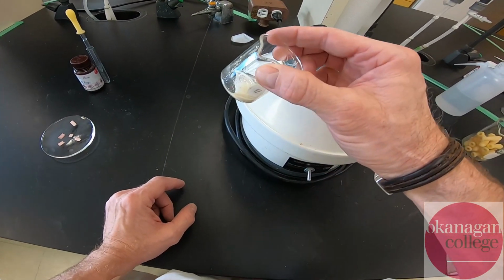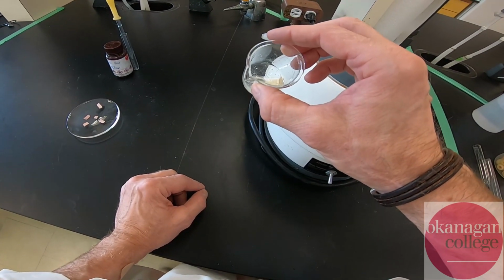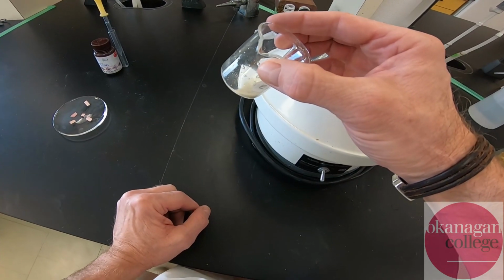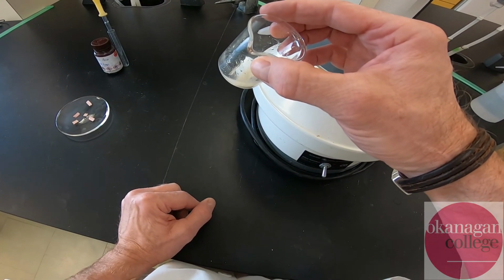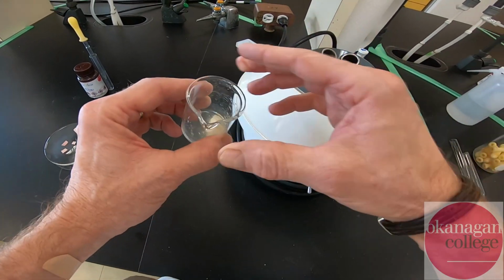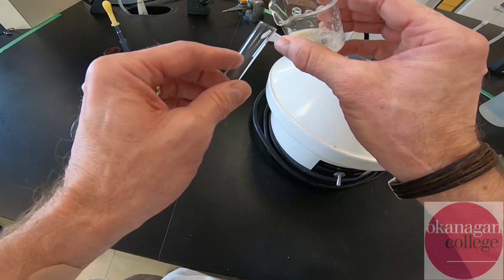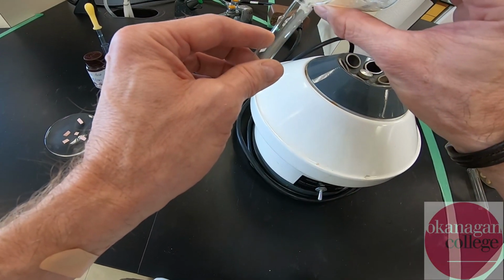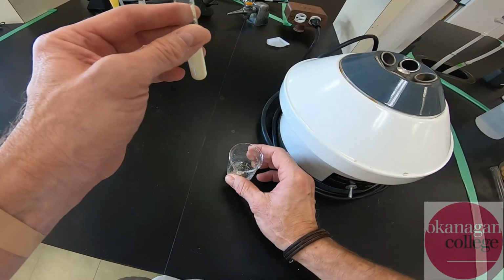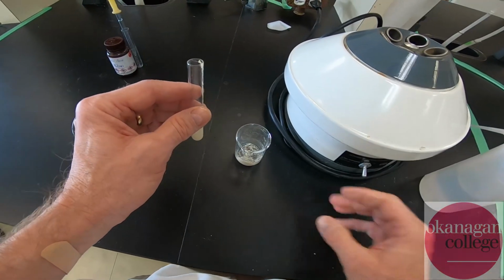It's not an unreasonable suggestion that we would separate the liquid from the solid using vacuum filtration. It's just in previous experiences we found that this doesn't work very well. The filter paper clogs, and it's really an exercise in frustration. This seems to work quite well. So I'm going to be transferring this material as best I can into a test tube, and using very small amounts of water to help with that transference.